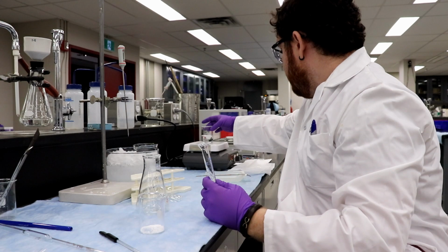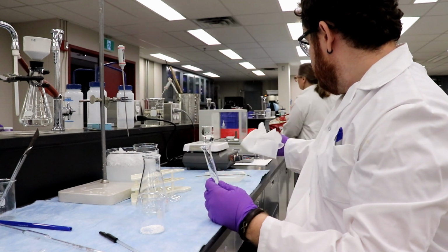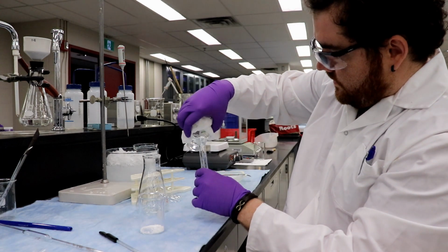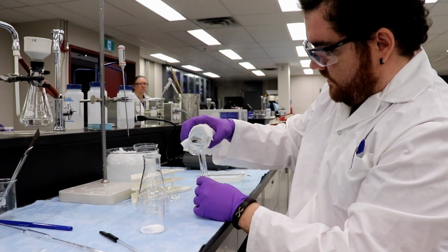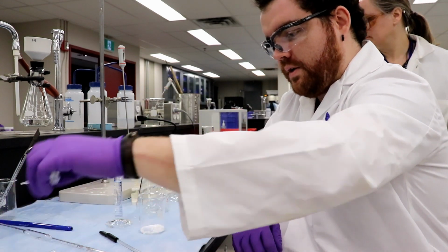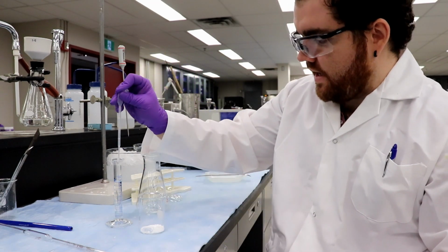And then we'll take our boiling hot beaker. Do you need something like a hot mitt? I'll go grab you a hot mitt just to be safe. We're good. Feel all that steam in my hand. Okay, so we have 10 mils boiling water. We're going to want to do this quick so that we don't just cool our water off. And I've got my glass stir bar here, so I can basically crush the crystals as I add it.